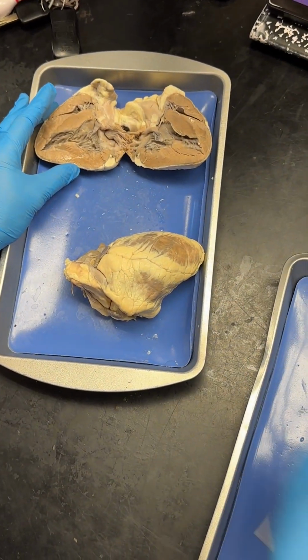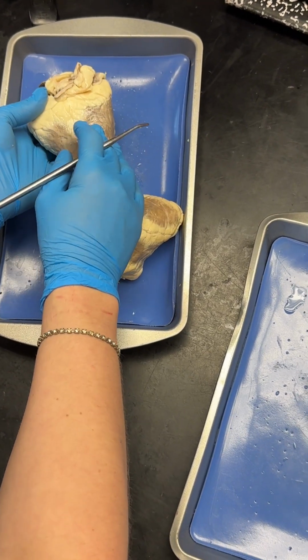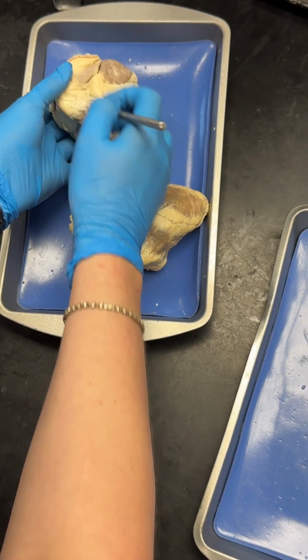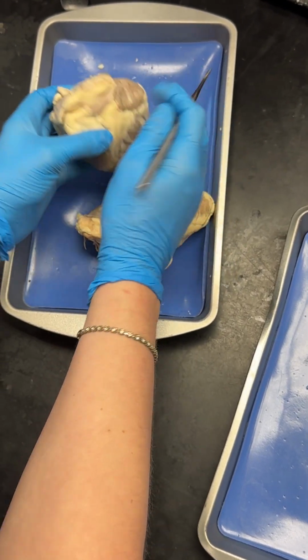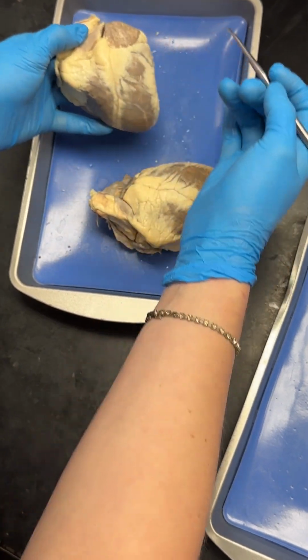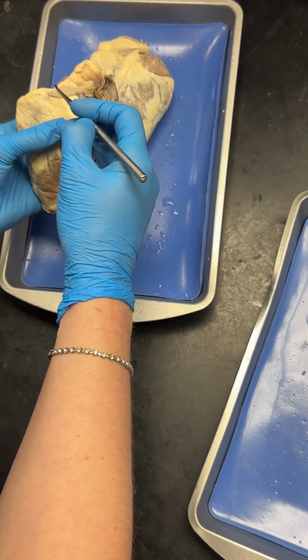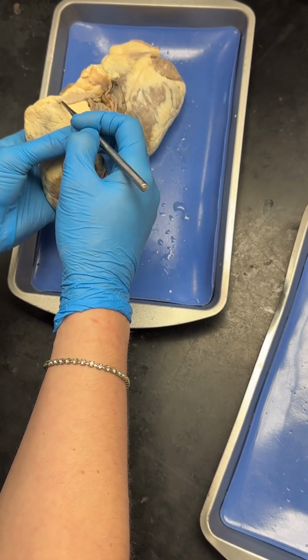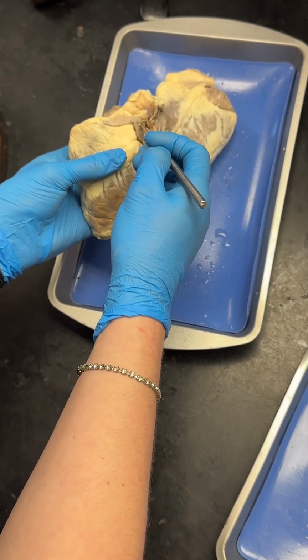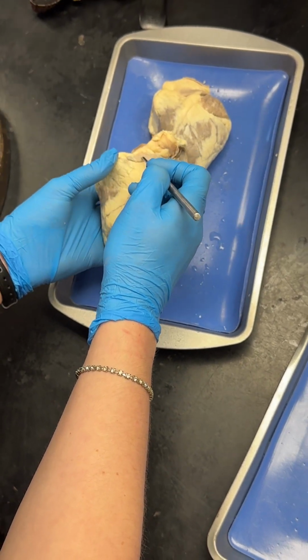All right, cool. So I'll start with it closed. This is going to be our sheep heart. Just quick, a lot of the vessels on the top are usually obscured in a lot of this fat and adipose tissue. But one that is usually very identifiable, and actually I'll use this sheep heart for that, is going to be this pulmonary trunk. This usually tends to be very characteristic and going at a very cross angle across the heart. And this also tells you where the front of the heart is.